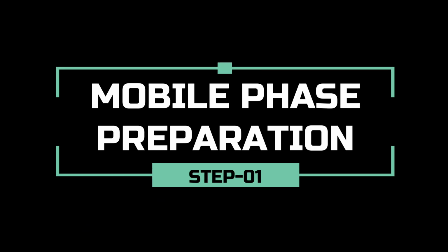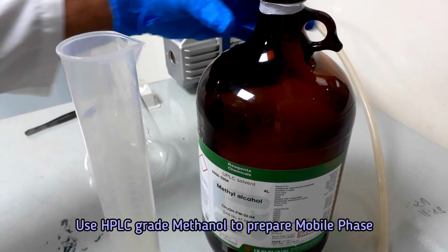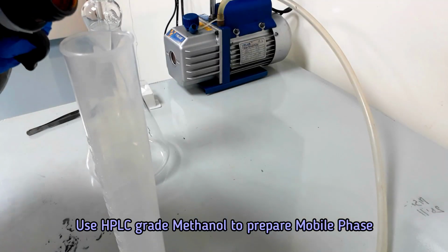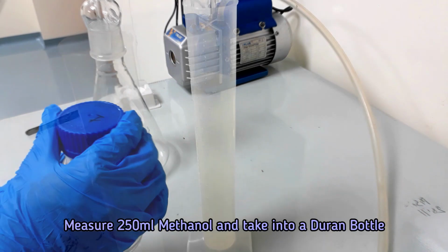Let's prepare the mobile phase, only methanol. Filter 250 ml HPLC grade methanol using 0.45 micrometer membrane filter.